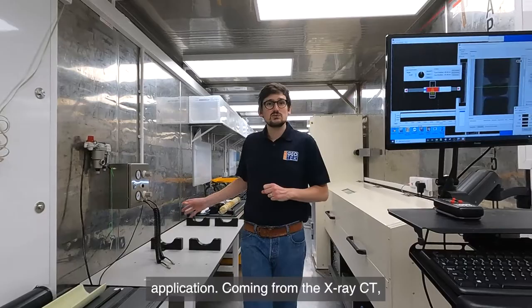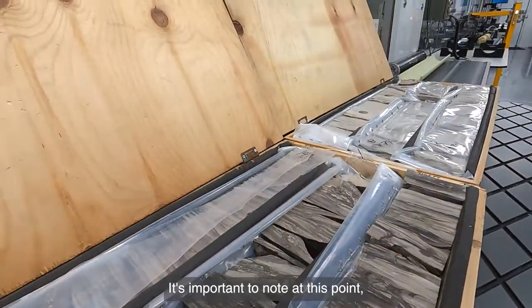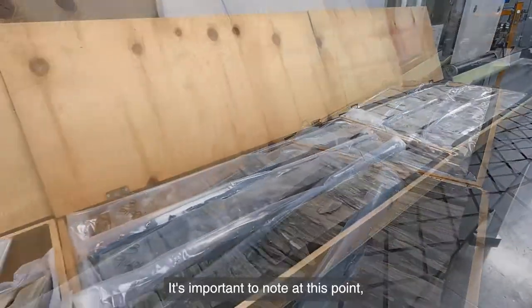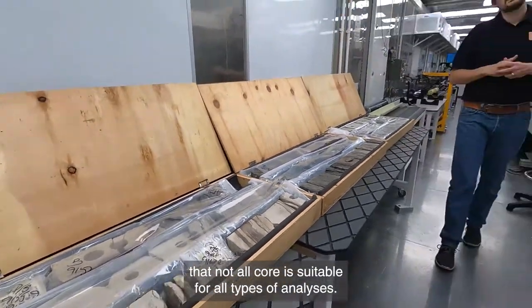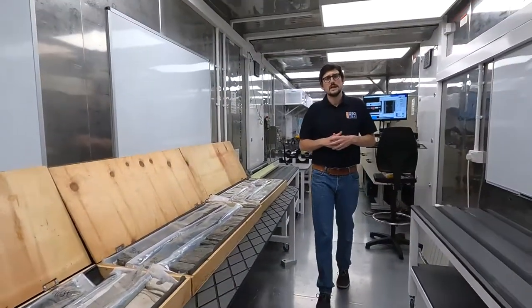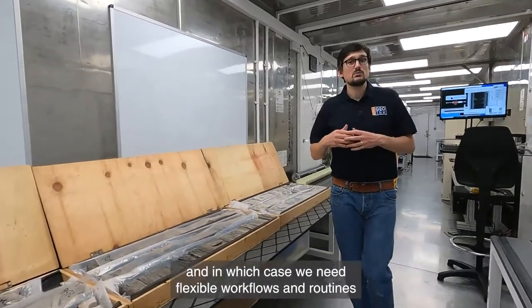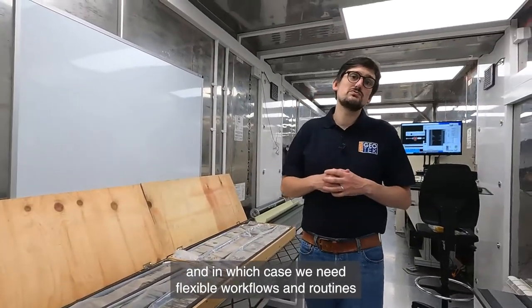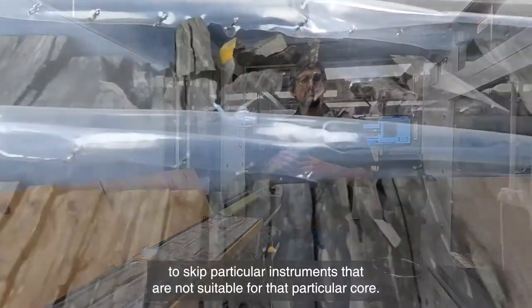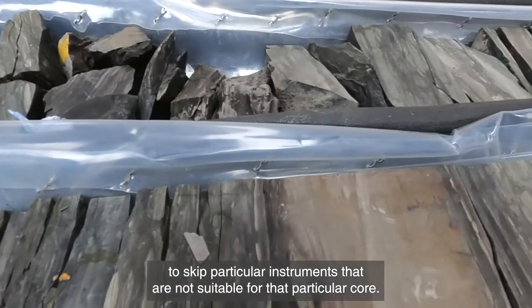Coming from the X-ray CT, we then place the core back into their boxes. Importantly, not all core is suitable for all types of analyses. Some core can be broken, some can be friable, and in those cases we need flexible workflows and routines to skip particular instruments that are not suitable for that particular core.